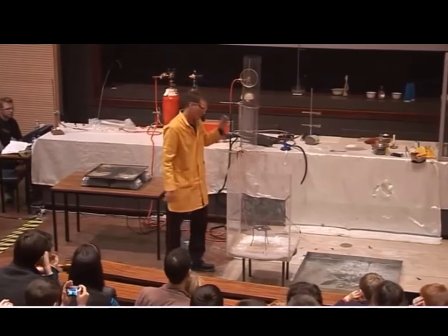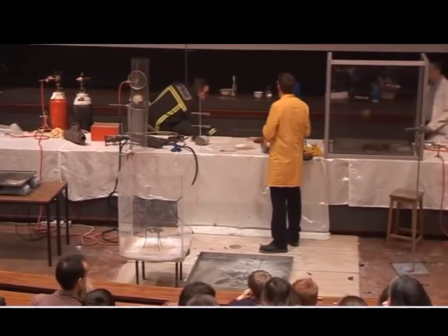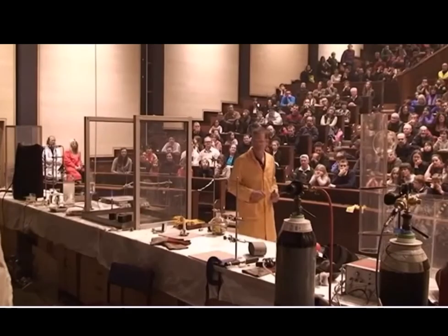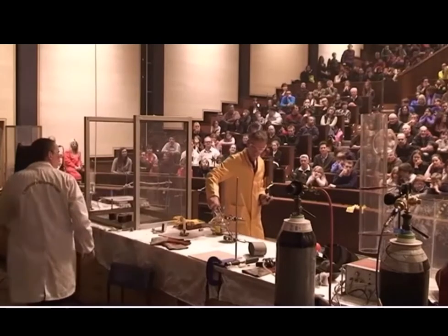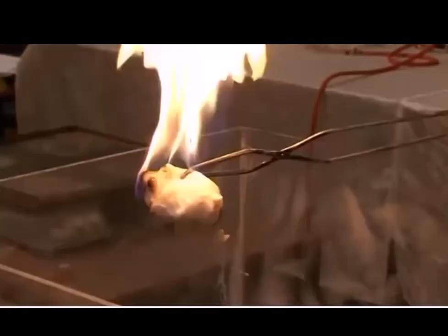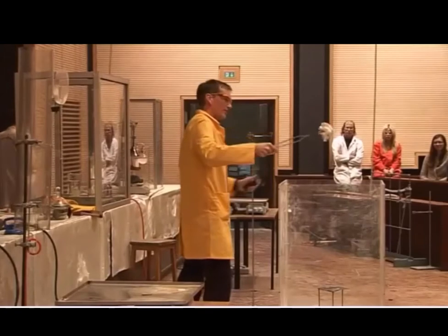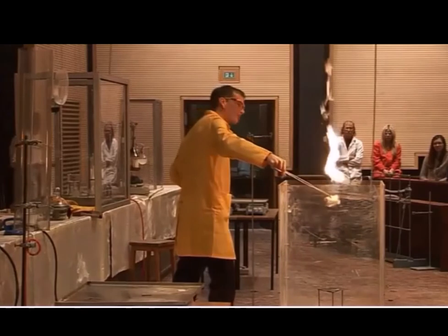So the big box that's been brought in here contains carbon dioxide. You'll see there's a tripod at the bottom of it, and he's going to put some burning magnesium into that shortly. And to prove that it's carbon dioxide, you remember at the start of the year we saw that carbon dioxide is used in fire extinguishers, so it puts out fires. So he's got a bit of mineral wool soaked in petrol, and if he tries to put it inside the box, you can see the fire goes out. So that whole big box, because carbon dioxide is heavier than air, that stays inside the box and it puts the fire out.